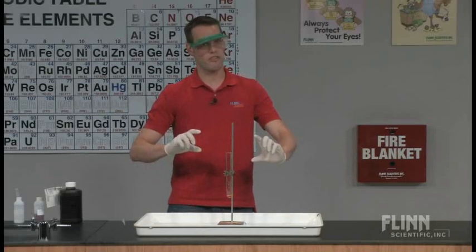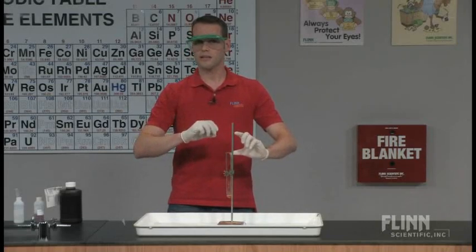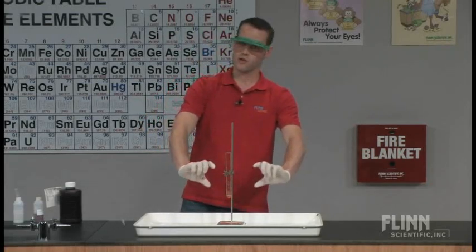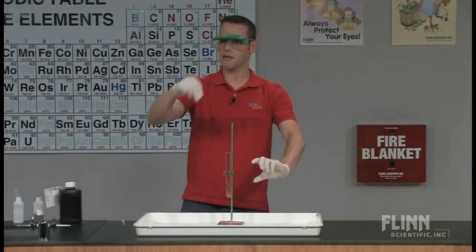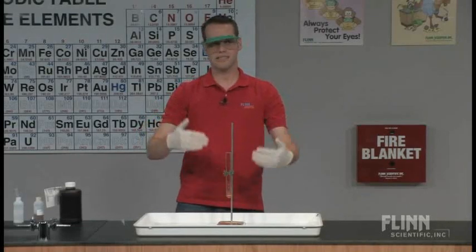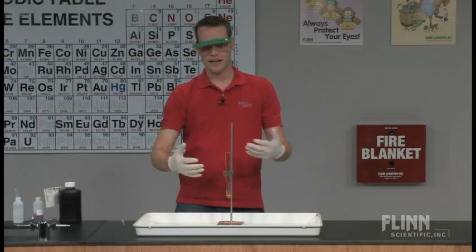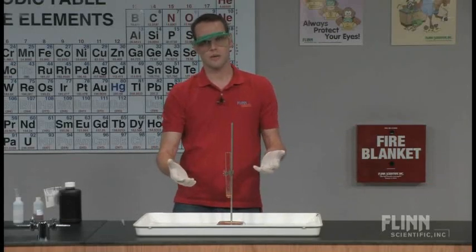So sometimes I'll take an equal volume of water, dilute it, add the same amount of the iron chloride that I did. So if I have 20 milliliters of hydrogen peroxide, I'll use 20 milliliters of water. Add the same amount of iron chloride beforehand so they can see that it's really just a dilution of the iron chloride that's happening here. It's not actually being chemically changed to new substance at the end.